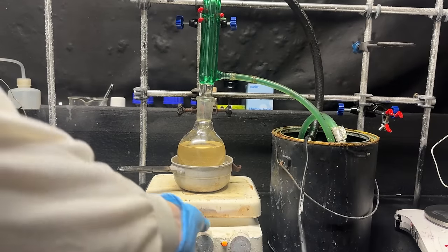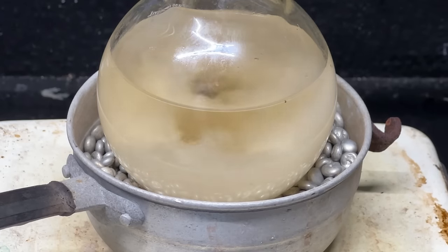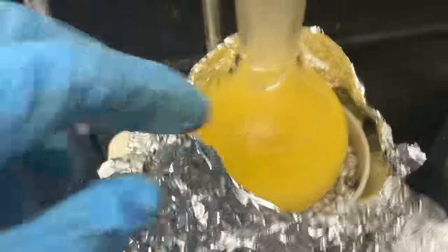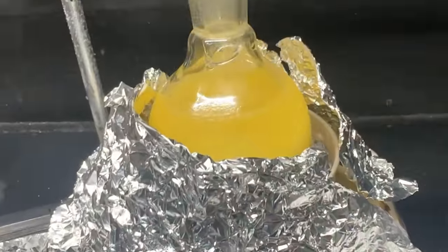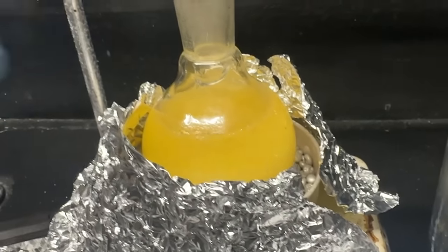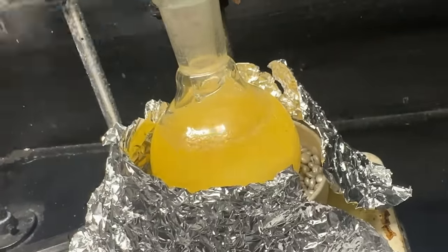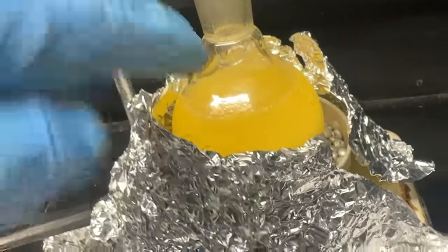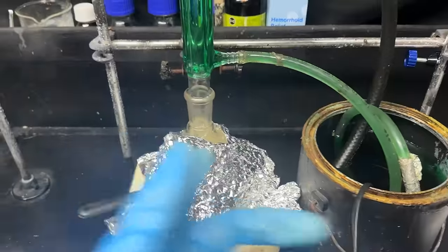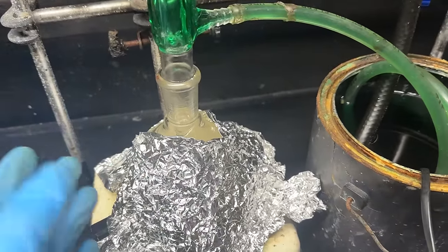One key feature I forgot: turn on strong stirring. We're definitely starting to get up to temperature because it's starting to reflux. But that's actually not the acetophenone refluxing — because of the imine formation we're forming a molecule of water, and that's what is refluxing right now. You can hear it: the water comes up, falls back down, and boils away. Also worth mentioning — we have to leave this for pretty much 30 to 40 hours.